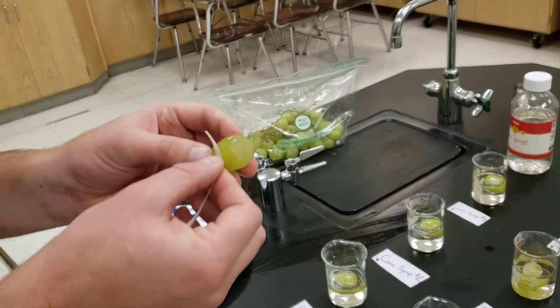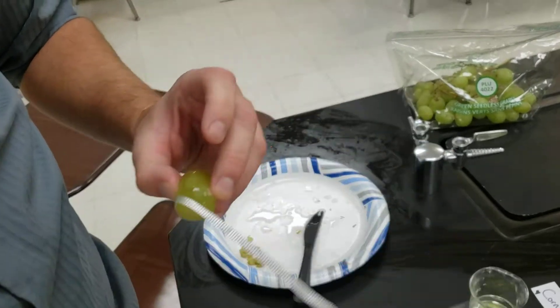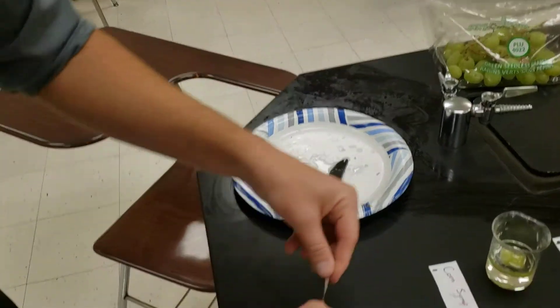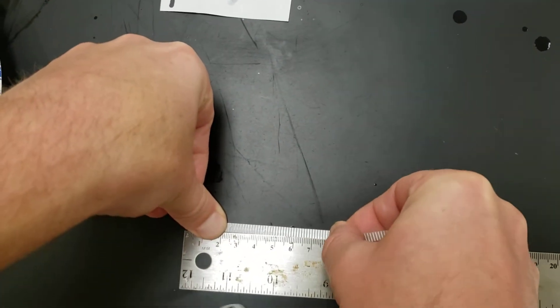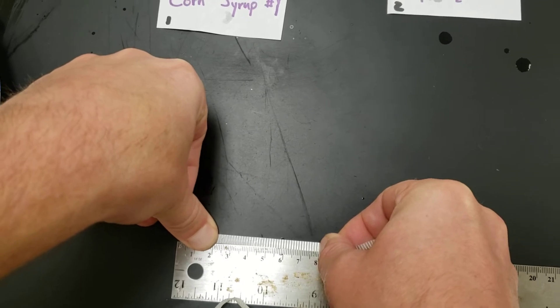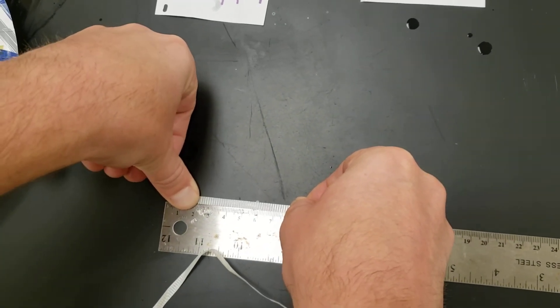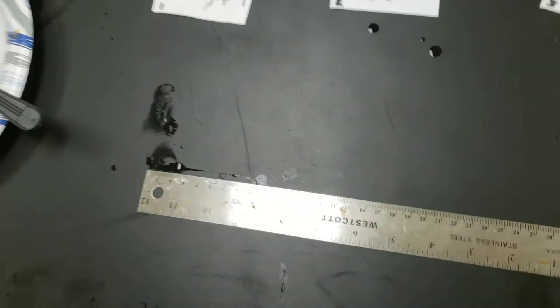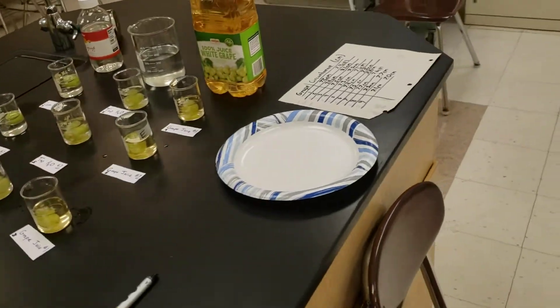So as you see here, let's do a little wrap here. Remember, we're always using the metric side of the ruler, and what we got here is just around eight, maybe 8.1. So we're going to put that on the data table, and if we take a look at grape two over here on the data table.